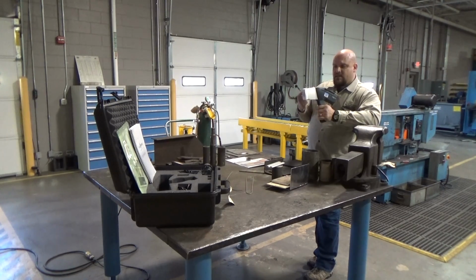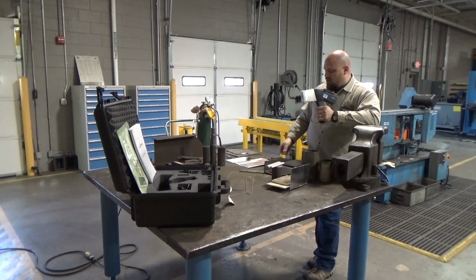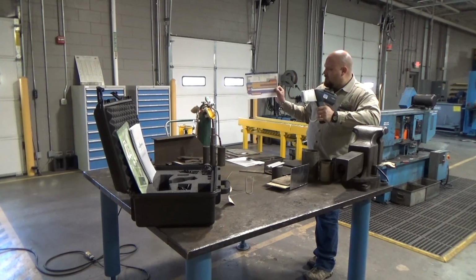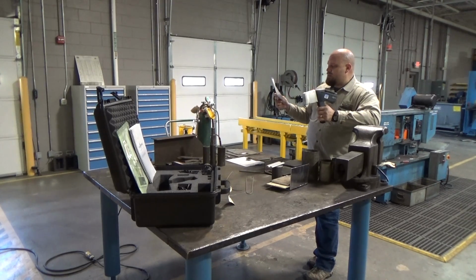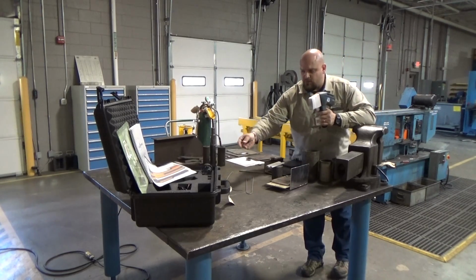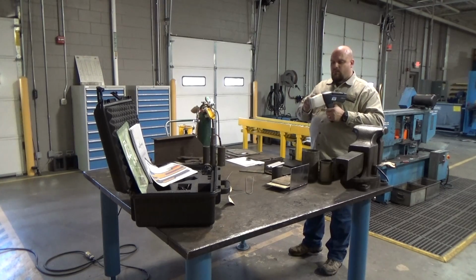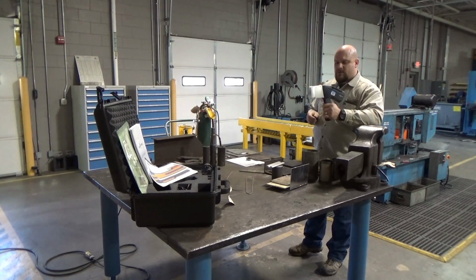Now the other thing is it doesn't have the ability to separate out what are known as the light elements, when we think about the aluminum and magnesium. So it doesn't have the ability to separate out those particular elements as we look at the periodic table. What it does is lump together all of these light elements and take them as one measurement. The atomic weight is so light it can't separate them out, but it does lump those elements together.